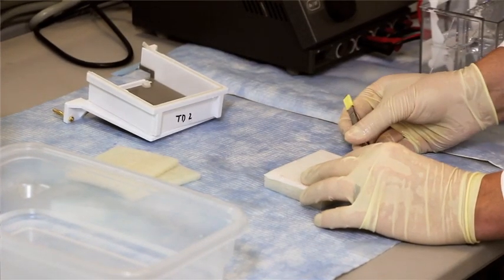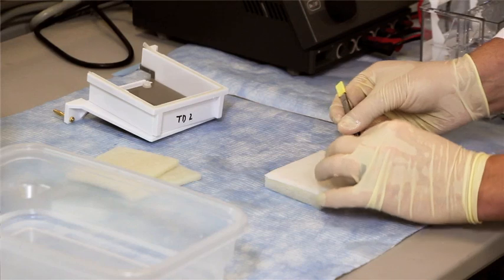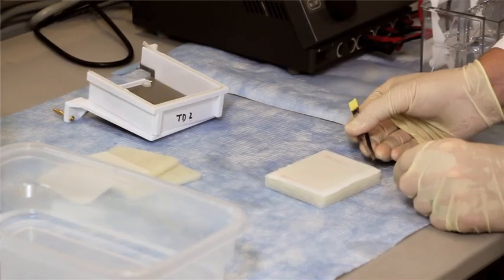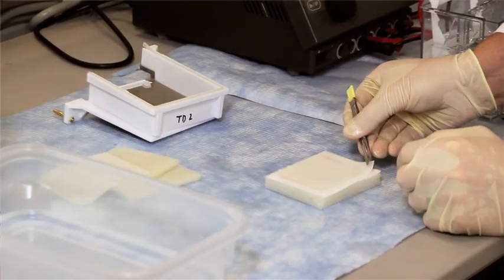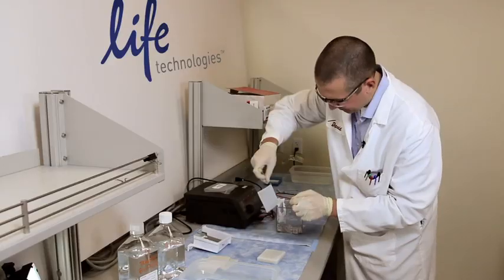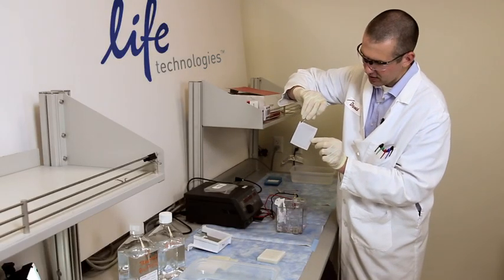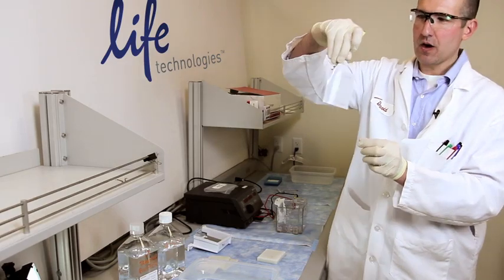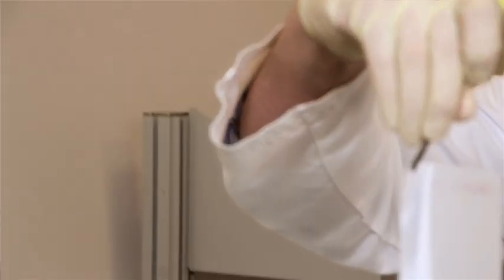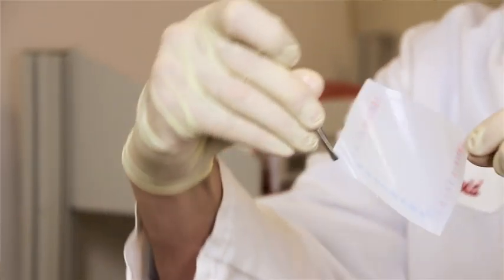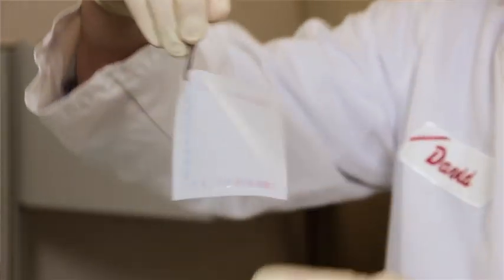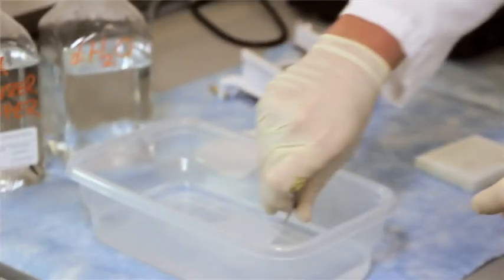And right underneath here is our blot. And as you can see here, our dye front was transferred and our NuPAGE standards were transferred. And so now this blot is ready for blocking.